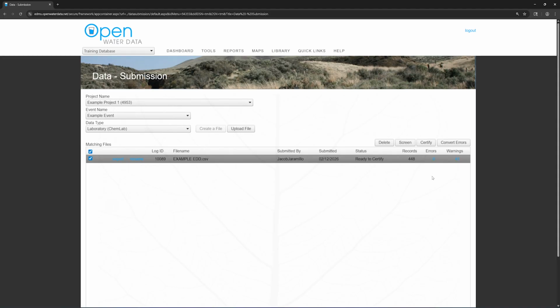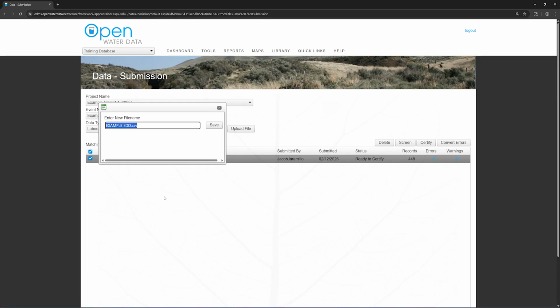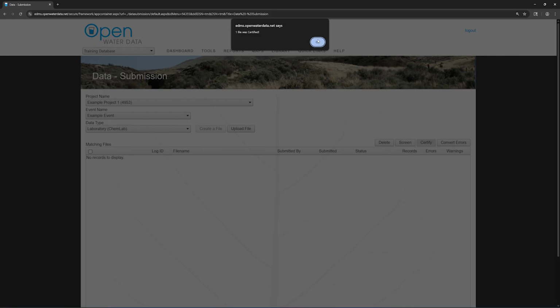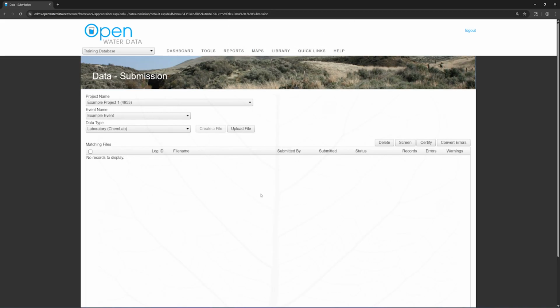If your file had errors, you would be able to click on the number of errors to access the error report. Once the file has 0 errors, it is ready to certify. As a best practice, click the Rename button to rename the file to match the SDG number, 23837 in this case. The name of your file comes up in reports and drop-downs, so it is important that it has the same name as the SDG for clarity. Select the file and click Certify. This sends the file into the queue where the ADR automatically applies qualifiers and the data validator can review it.